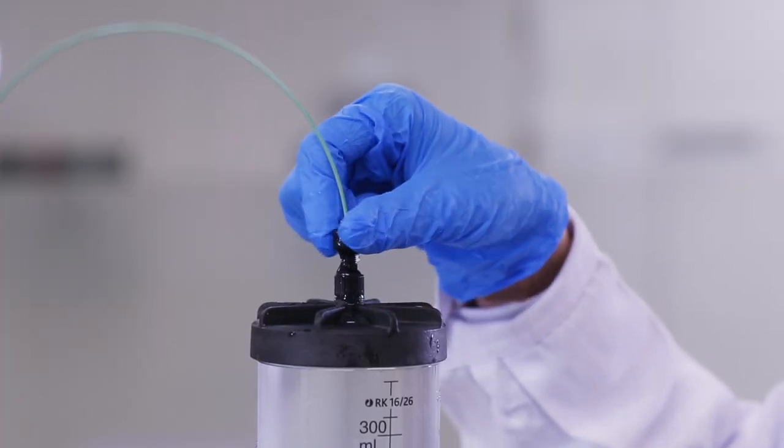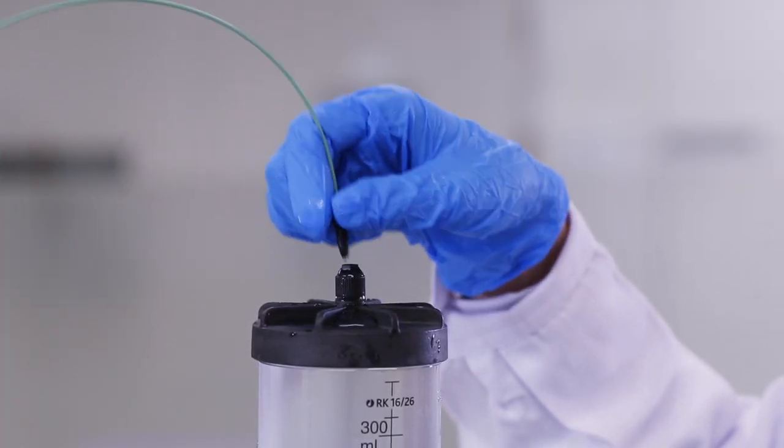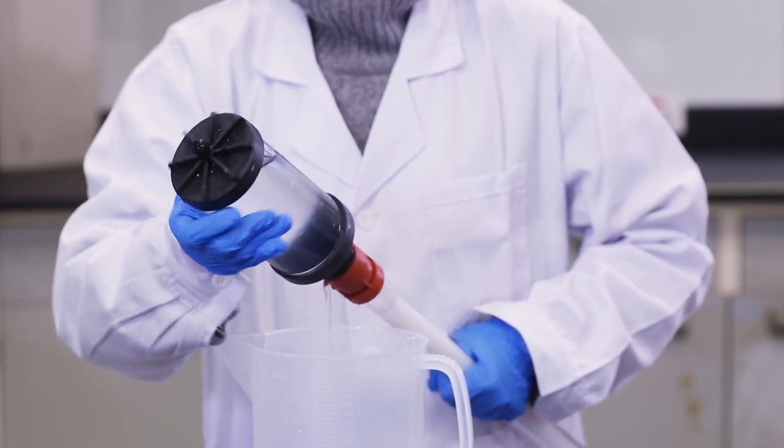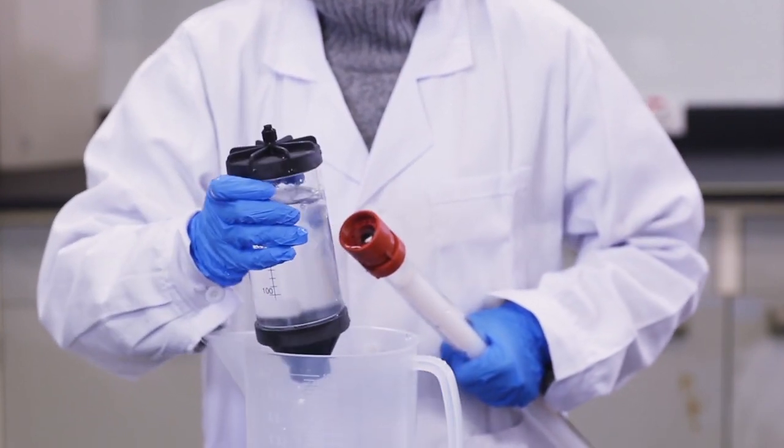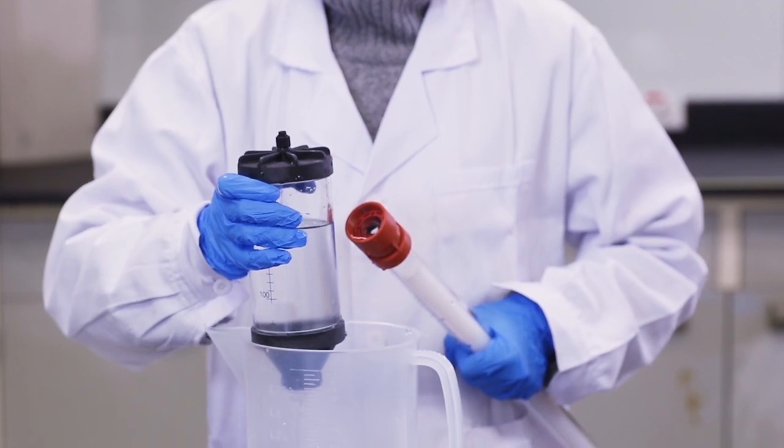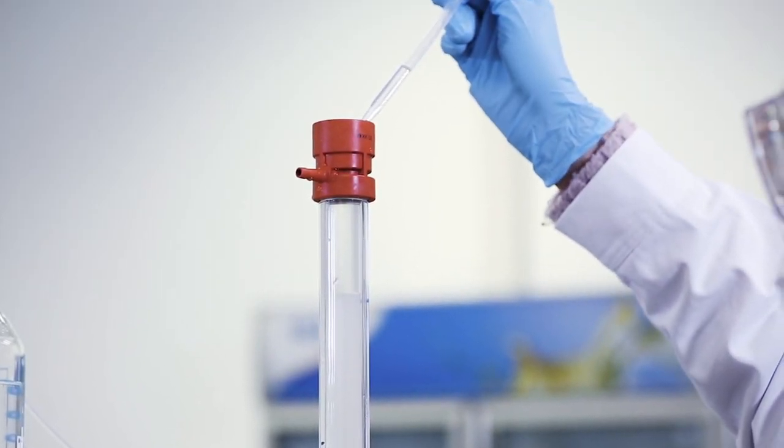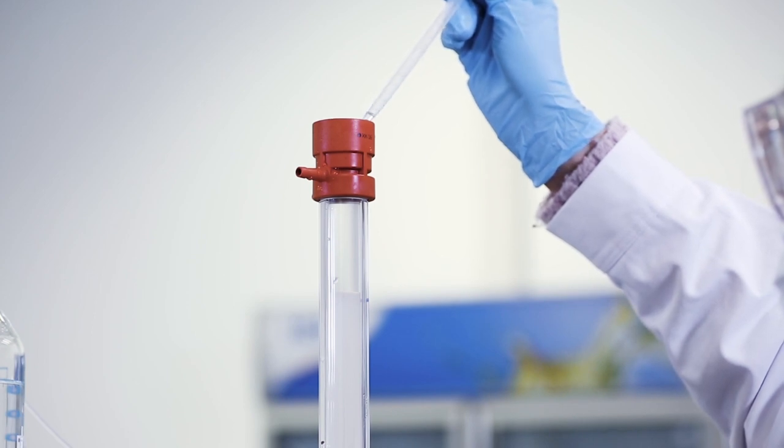Detach the column from the reservoir over a beaker. Add some packing solution, in this case distilled water, to the top of the column.